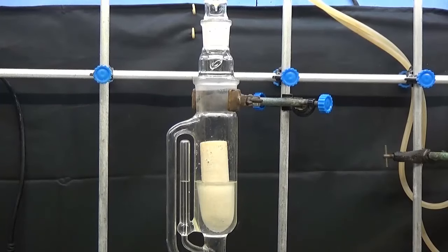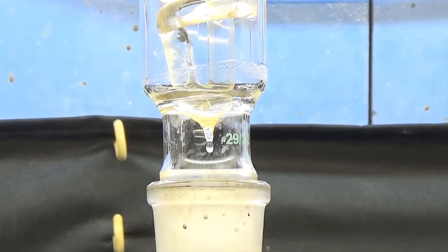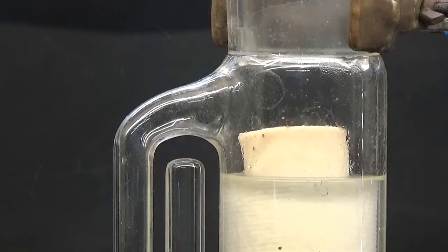We will conduct four operations of 30 grams, an extraction time of five to six hours each.